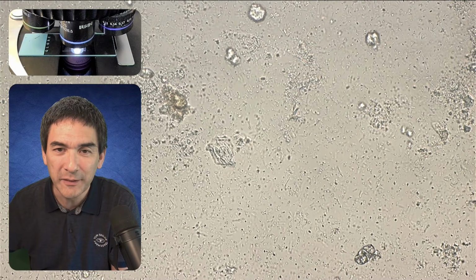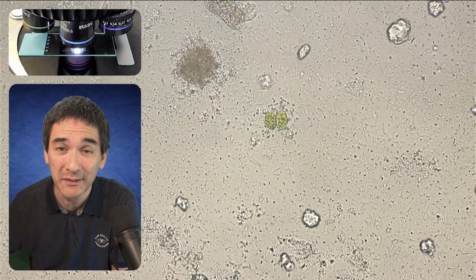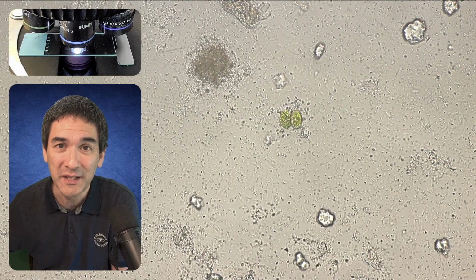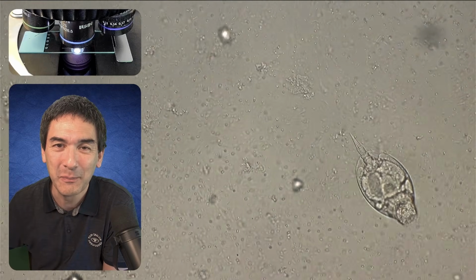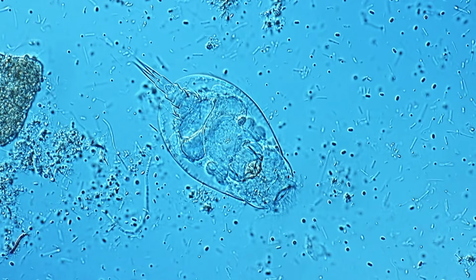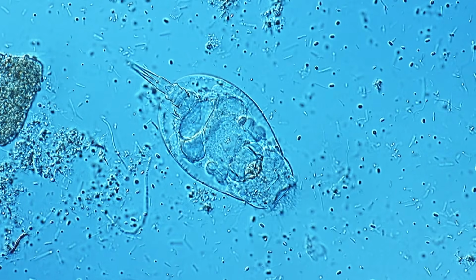Here in bright field we can already see that there are plenty of bacteria. They have not yet formed an aerotactic band, so I have to wait approximately 10 to 20 minutes, and then I'm also able to see that. In the meantime, we can observe the many water microorganisms that are also present here. For example, this is a little rotifer feeling very happy because the bacteria are an important food source. That's also one of the reasons why those rotifers started to multiply very rapidly in the water sample.